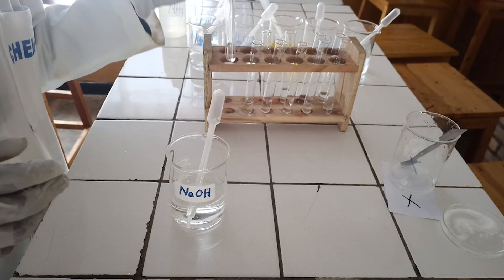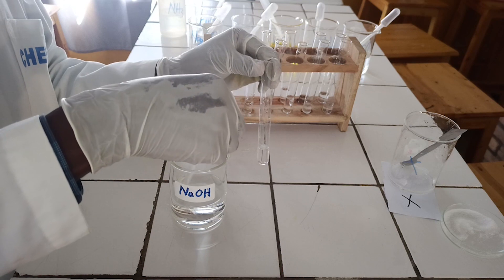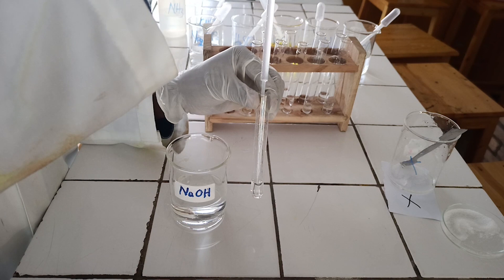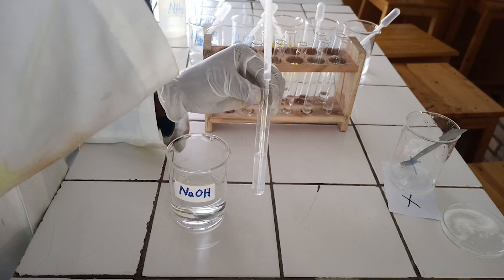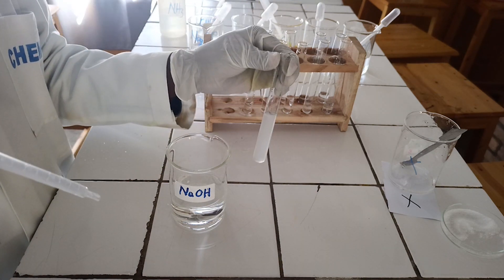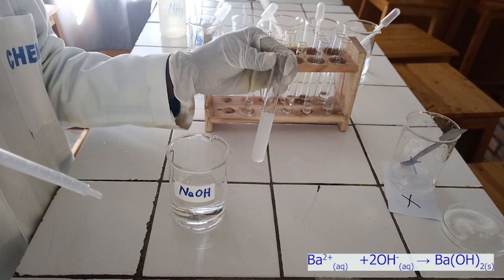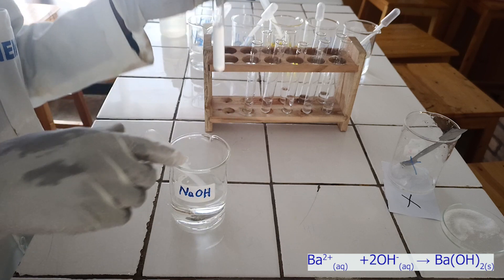To the first test tube, add sodium hydroxide solution dropwise until in excess. As you see, sodium hydroxide reacts with barium ion to form a white precipitate, which is insoluble in excess of sodium hydroxide. Below, there is the ionic equation for this reaction.